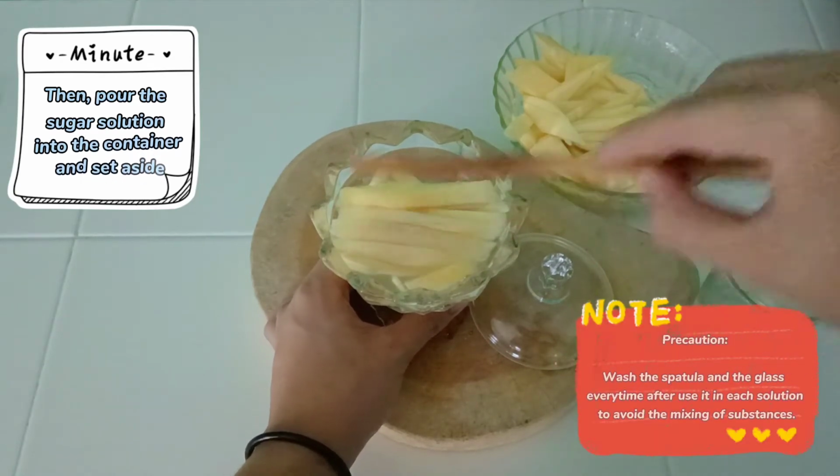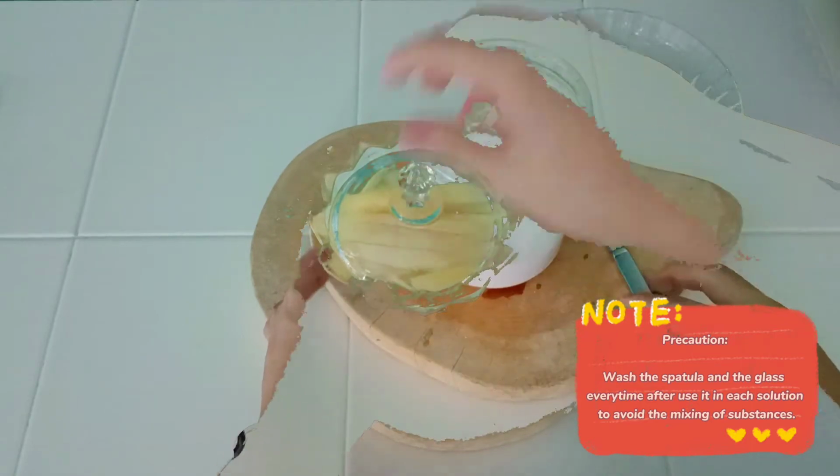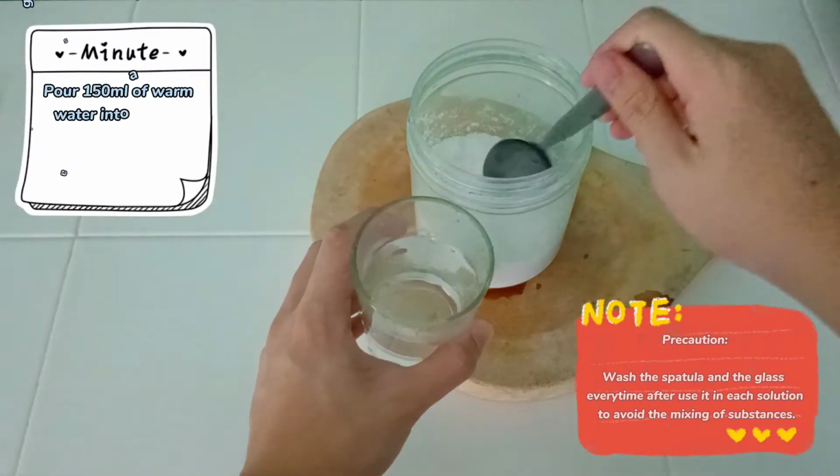Precaution: wash the spatula and the glass every time after use in each solution to avoid the mixing of substances.